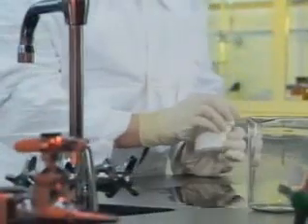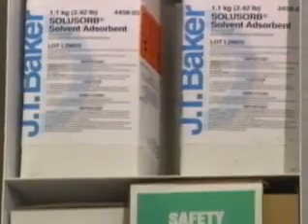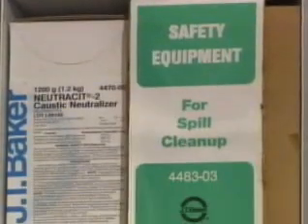And while you should be careful and try not to spill the chemicals, it sometimes does happen. What is important now is that they get that spill cleaned up right away before it comes into contact with someone or the equipment. They should also keep in mind the proper method to use to clean it up. It's really a race against the clock here. What method should they use?